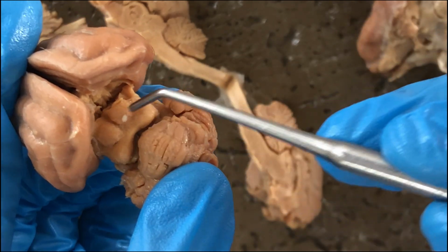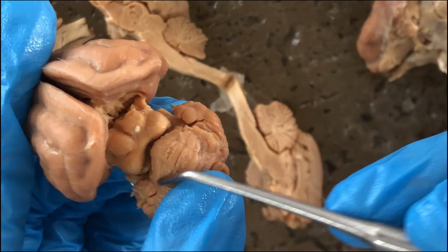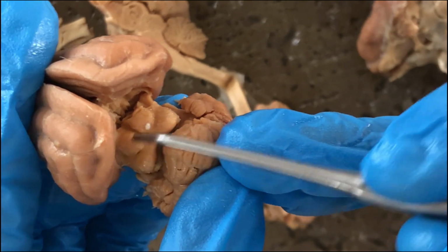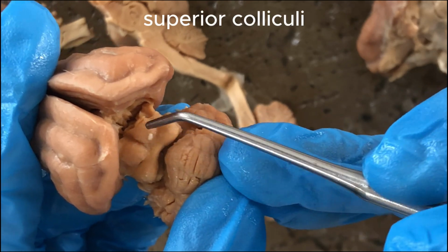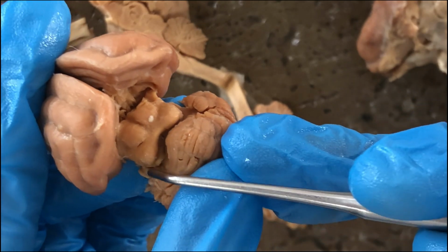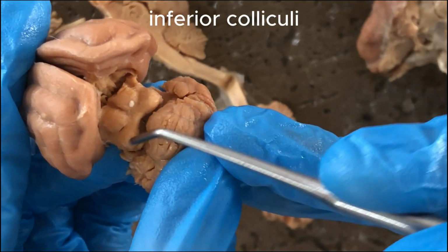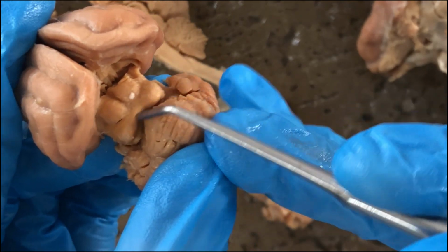So this entire structure would be part of the midbrain, called the corpora quadrigemina. Specifically, those 2 anterior globes there are the superior colliculi, involved in visual reflexes, and the posterior 2 globular structures there are the inferior colliculi, involved in auditory reflexes.